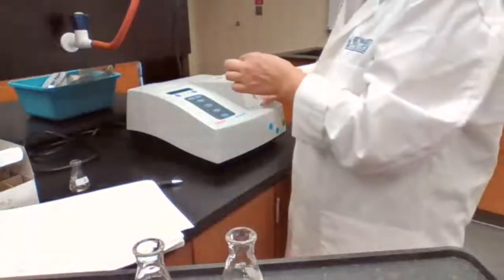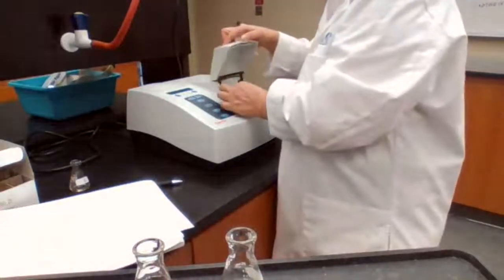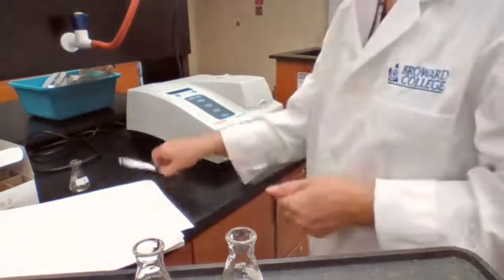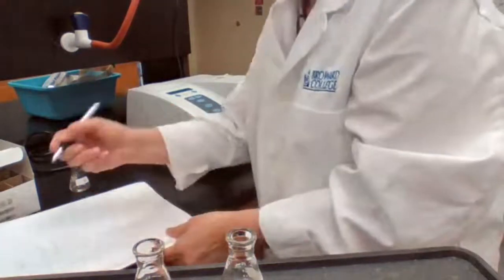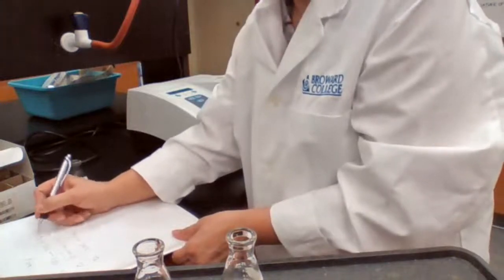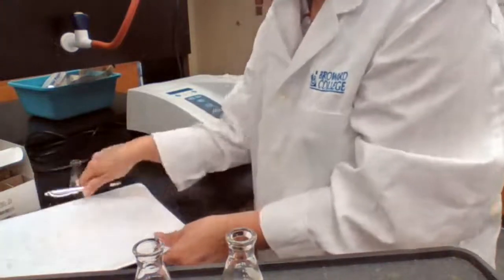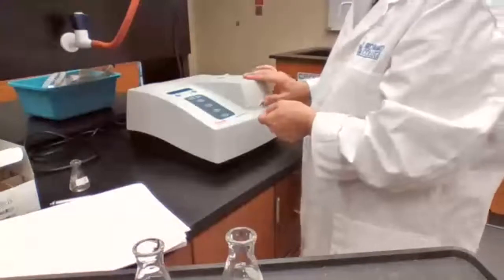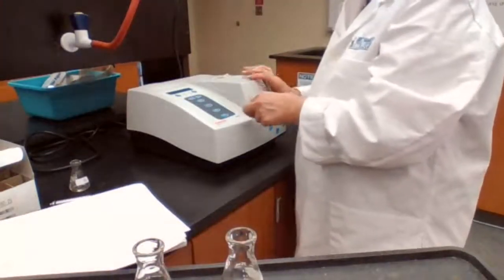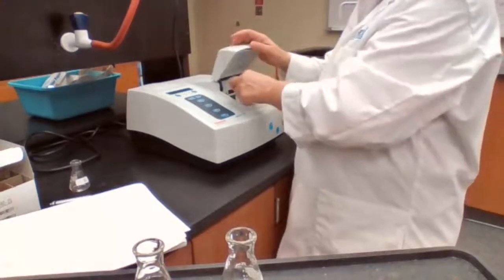Okay, 2:03. I need to read the sample B. When I read the sample B, I record the number, 91.7%. Okay, 91.7%. And it doesn't change.